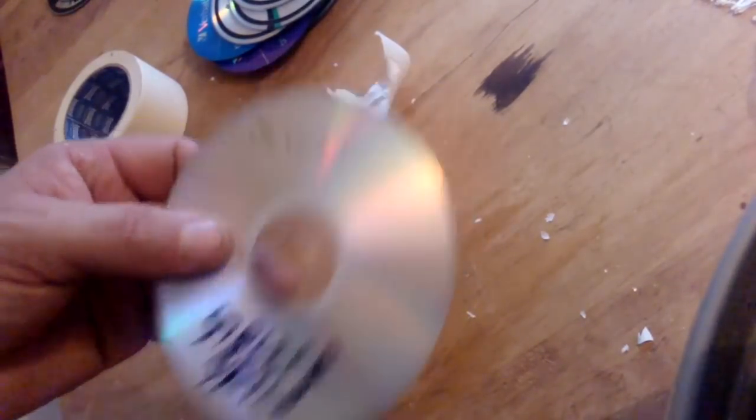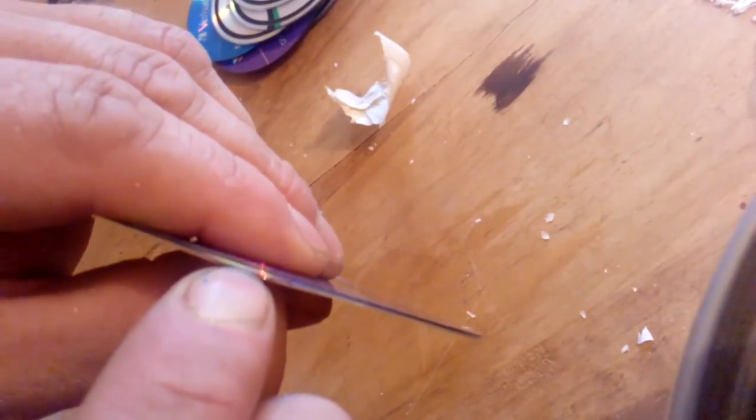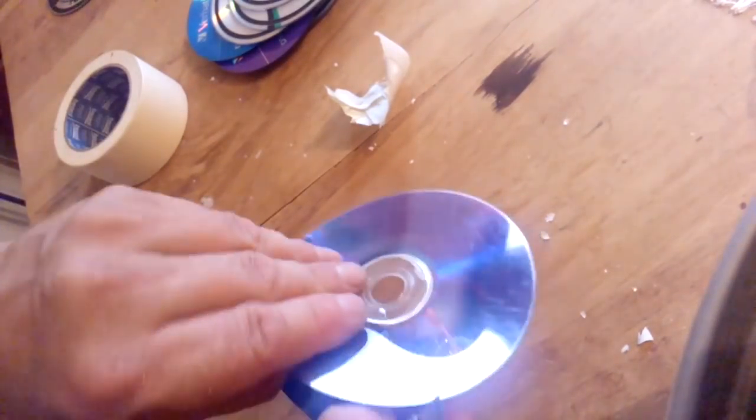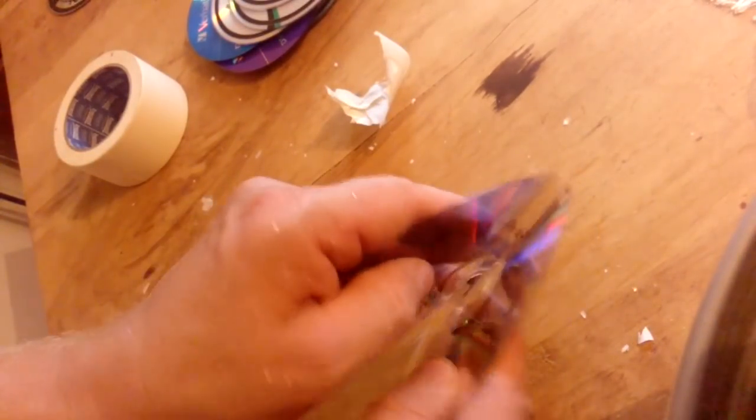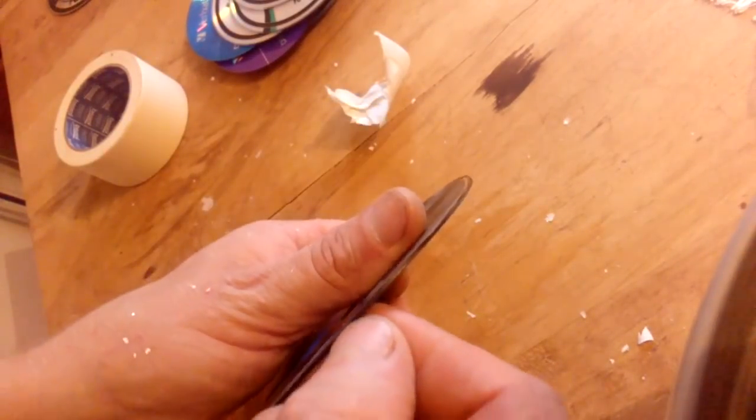Well now we got some other type. Okay, this one. This is pretty common. We got some sticker here, but this is old disc, everything is scratched. And you see that? We'll burn it. It's pretty much, you just got the nail, and when you feel - see that? I do that with a nail. Okay. This happens sometimes. We don't need knife this time. So okay, this one is broke. But never mind, we don't need plastic, we just need the - see? Pretty cool.